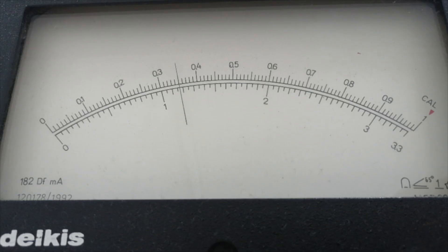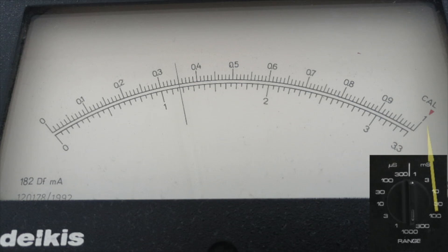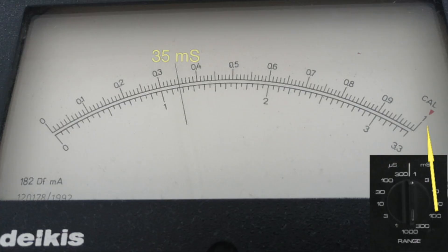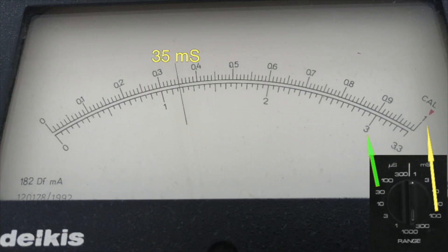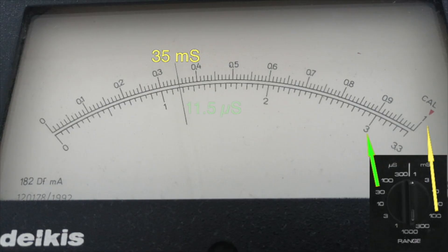For example, in this case, since the measuring range is 100 mS, the value of electrical conductance is 35 mS. Instead, if the measuring range would be 30 µS, at the same position of the indicator, we will read the conductance value of 11.5 µS.